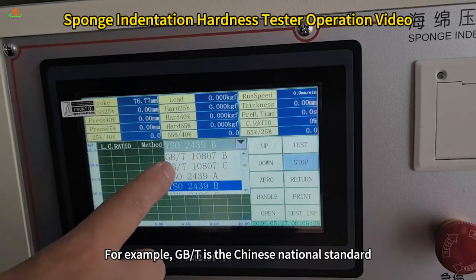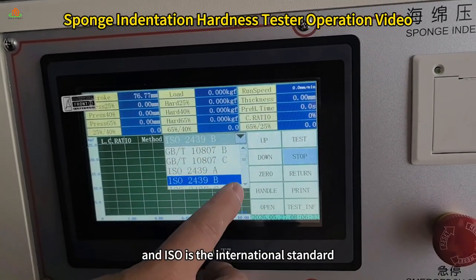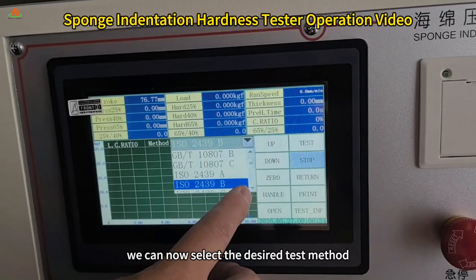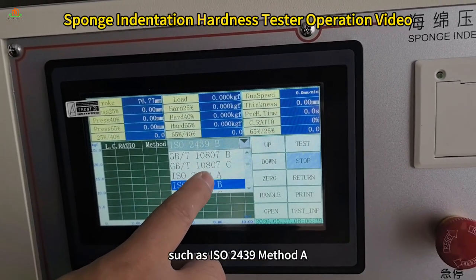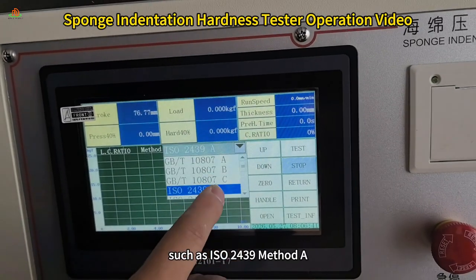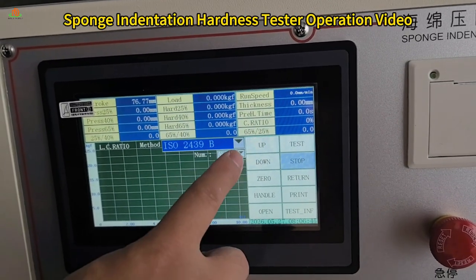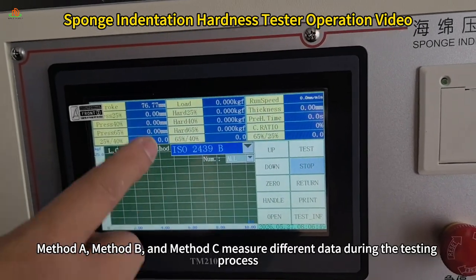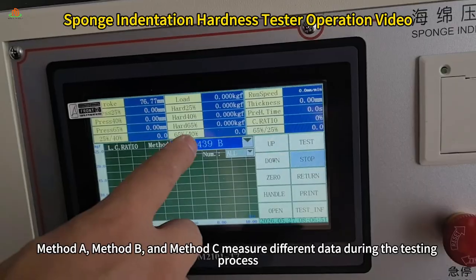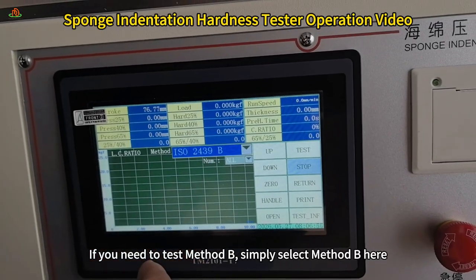For example, GB/T is the Chinese national standard, and ISO is the international standard. We can now select the desired test method, such as ISO 2439 method A, or continue scrolling down to select method B. Method A, method B, and method C measure different data during the testing process. If you need to test method B, simply select method B here.